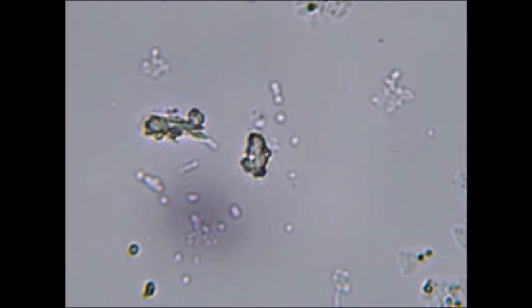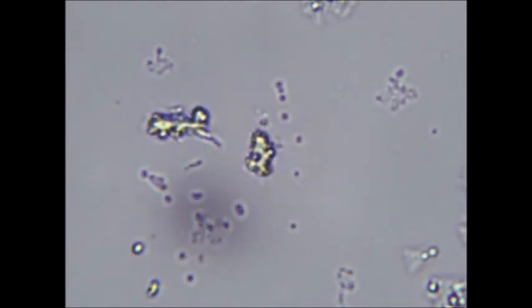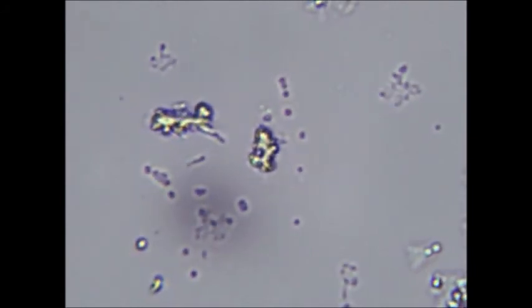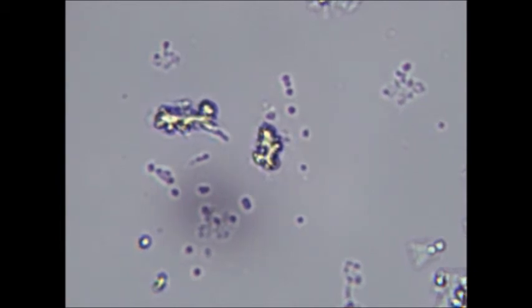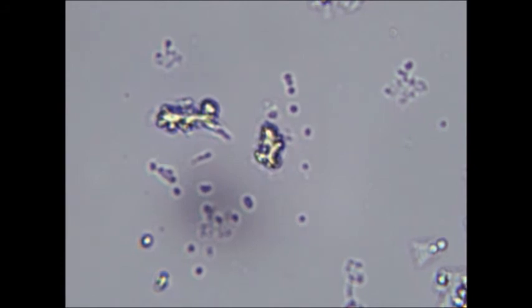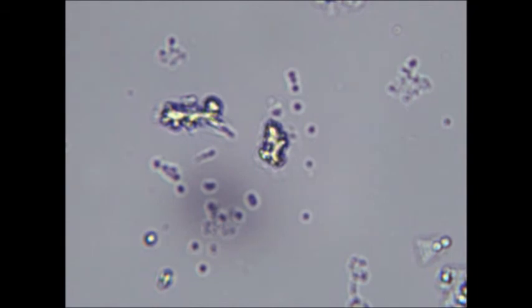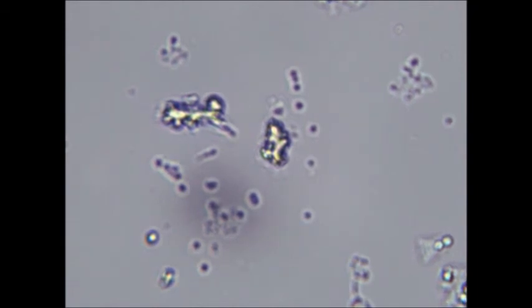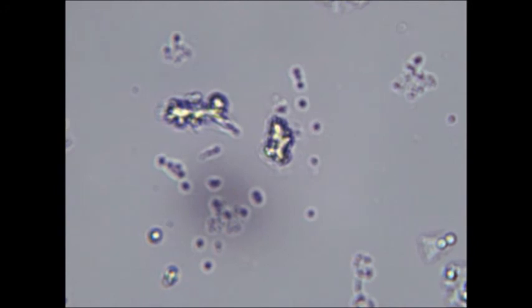I want to try the next experiment with as few added chemicals as possible, working with only the two gases, carbon monoxide and hydrogen, and only adding a couple of catalysts which are necessary to produce fatty acids. Another improvement which I will make is that I have another hydrothermal reactor which is on order right now. It is a super deluxe version which will allow me to monitor the temperature and pressure of the vessel.